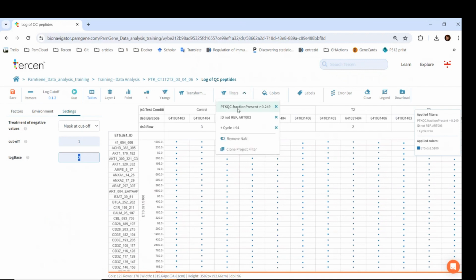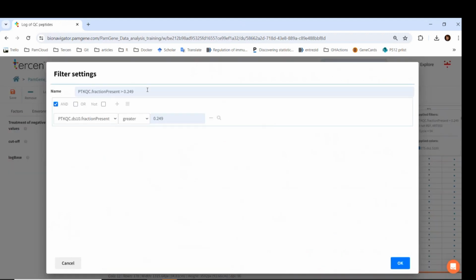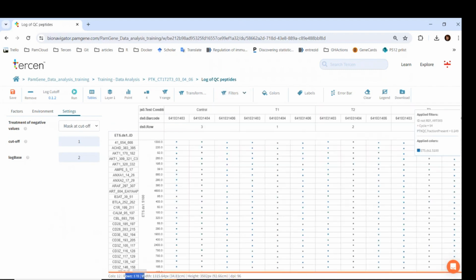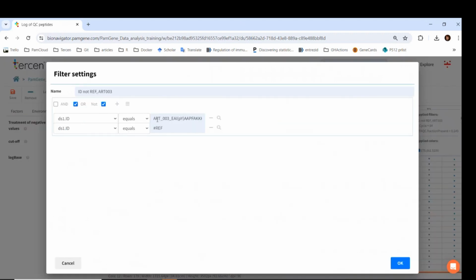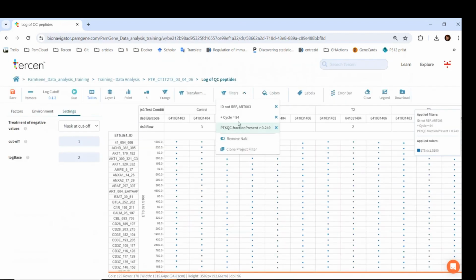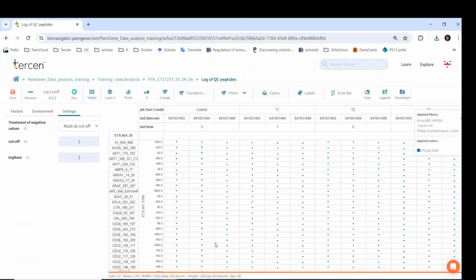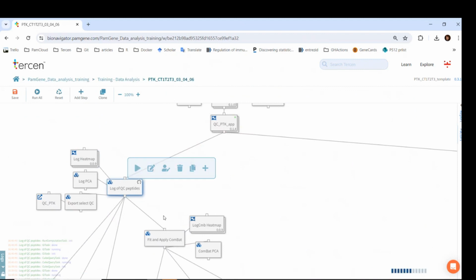Importantly, there is a filter coming from the PTK QC app, the fraction present higher than 0.249. You can also see that the number of rows is lower than the number of peptides on the chip. This is also because there is an additional filter to get rid of the positive control and the reference spot. Additionally, we also filter for cycle 94 since the previous cycles were only needed for the QC app. Now, let's go back to the template and run the step.